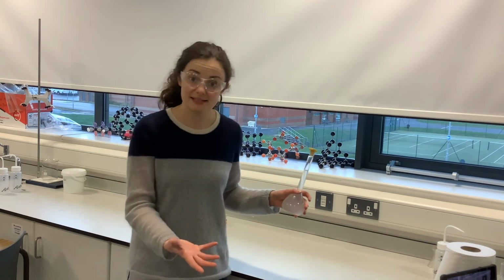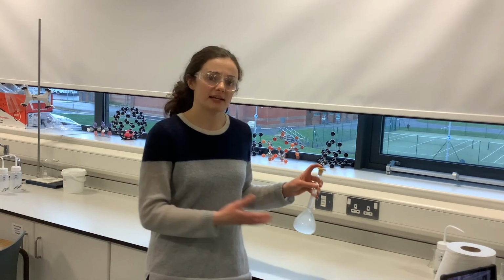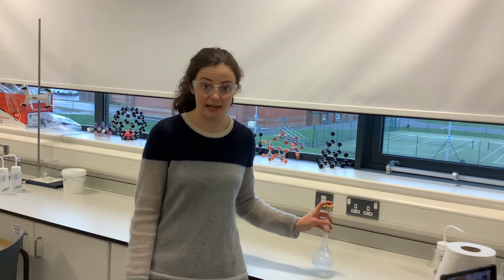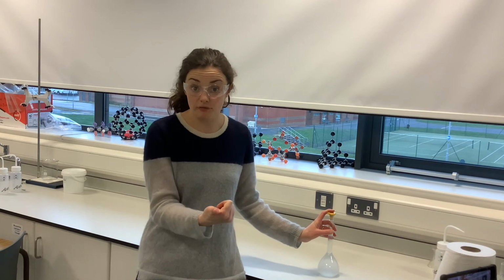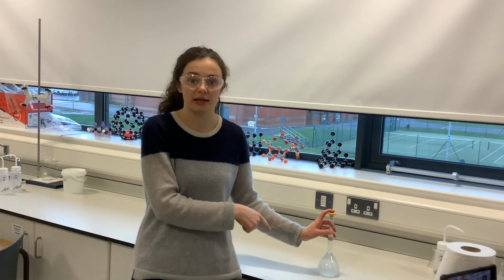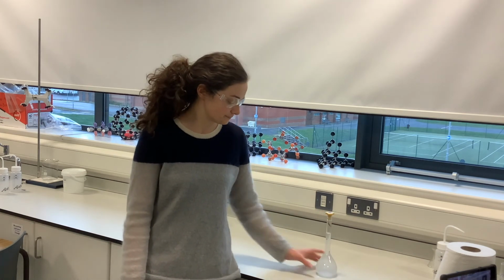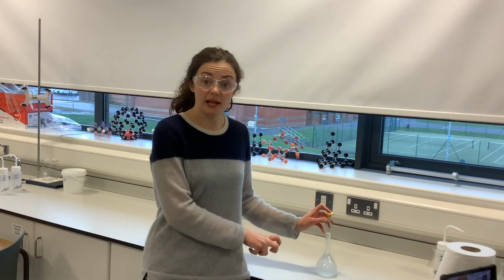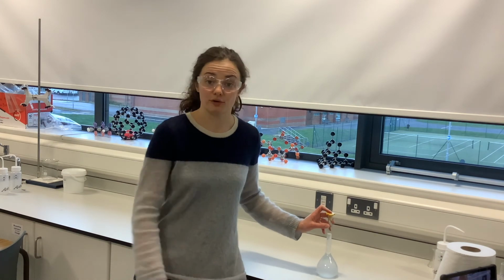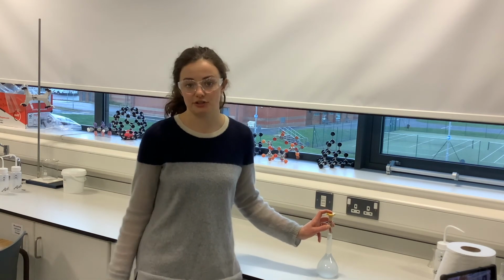It's a long process in some ways. As you get practice in it, you obviously get quicker, but it's something you need to take your time with and be really accurate, because as I said, we need to know the mass of our solid in this solution accurately, and we need to know the volume of water in it as well. So what we're going to do now is take this solution, take part of it out, and titrate it in order to work out how many moles of sodium carbonate I have in this solution.